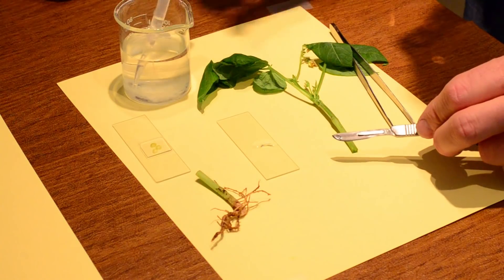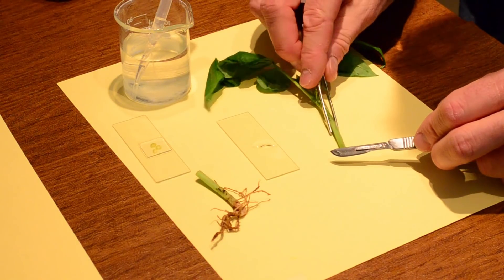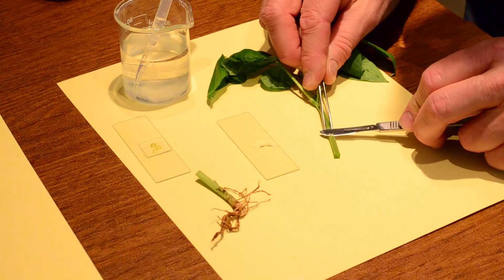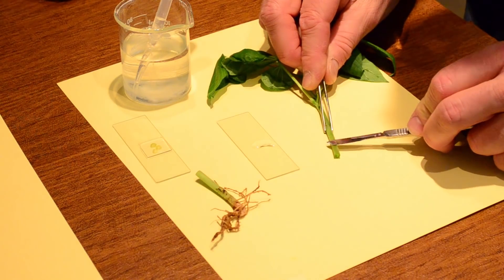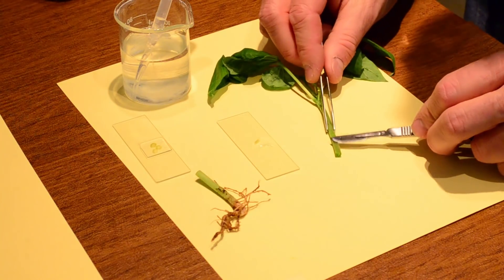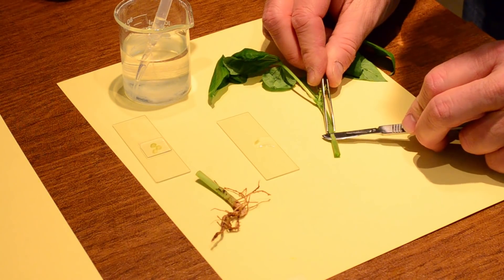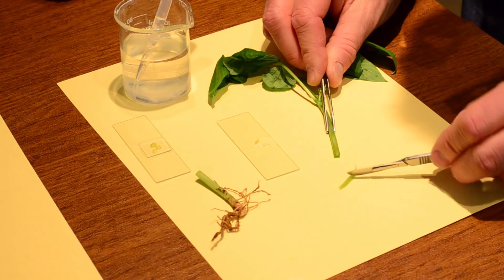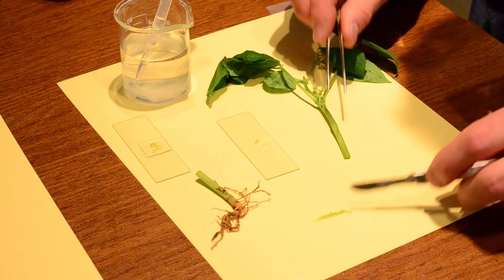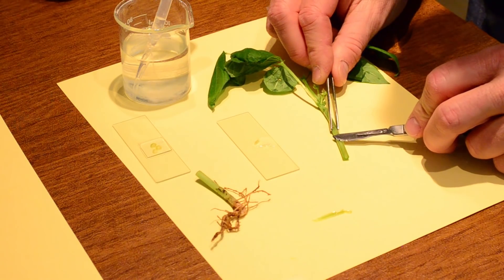That's beautiful. I'm going to do another one. Just to show you, you only need to do one in class. Here's another one. This one's a lot easier for me. I'm going to go down like this. And then I'm going to get another cross section. Or excuse me, longitudinal section a little deeper. Right there.